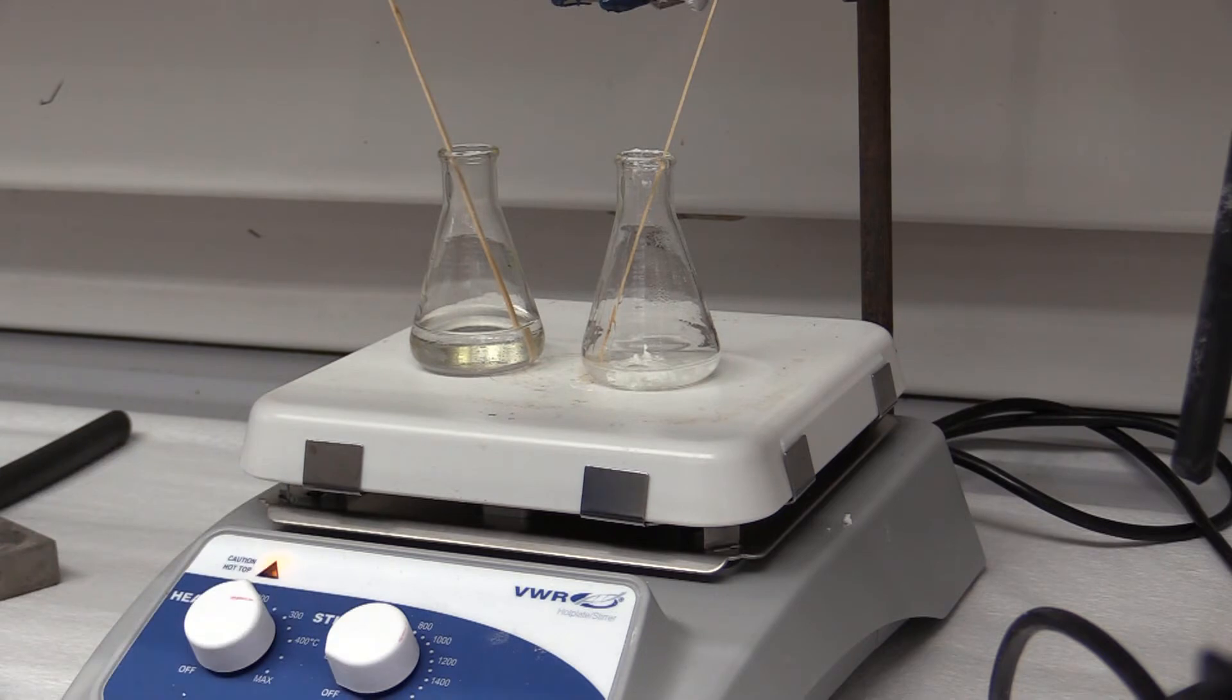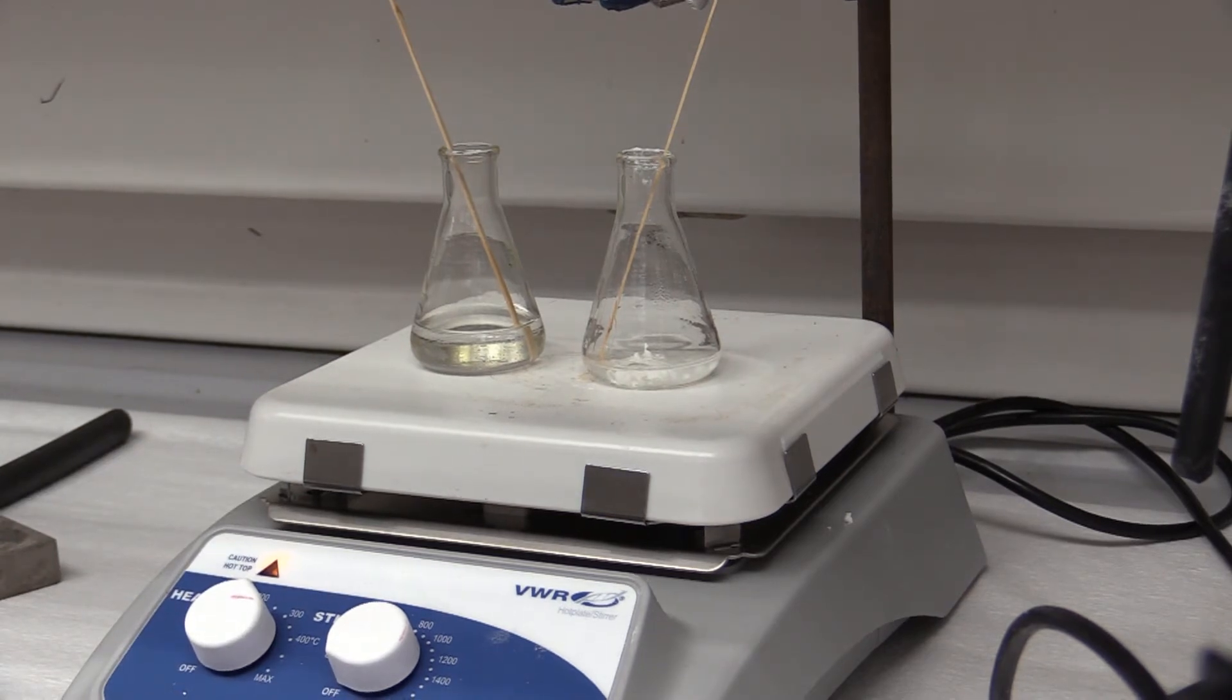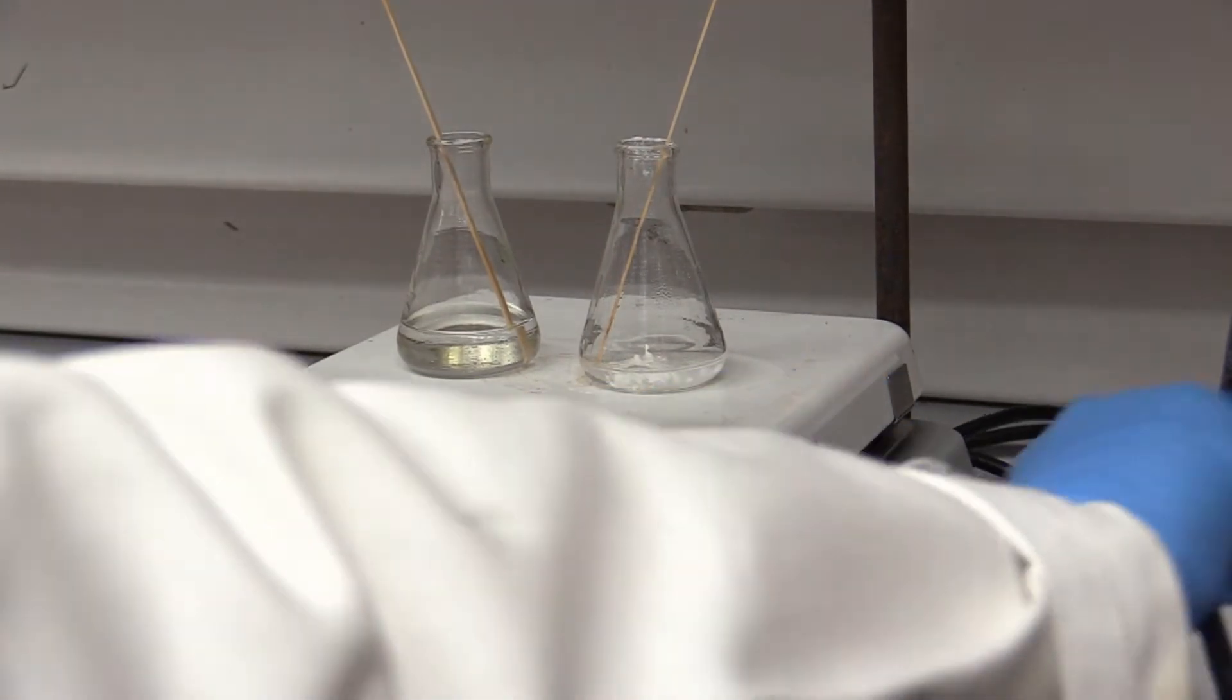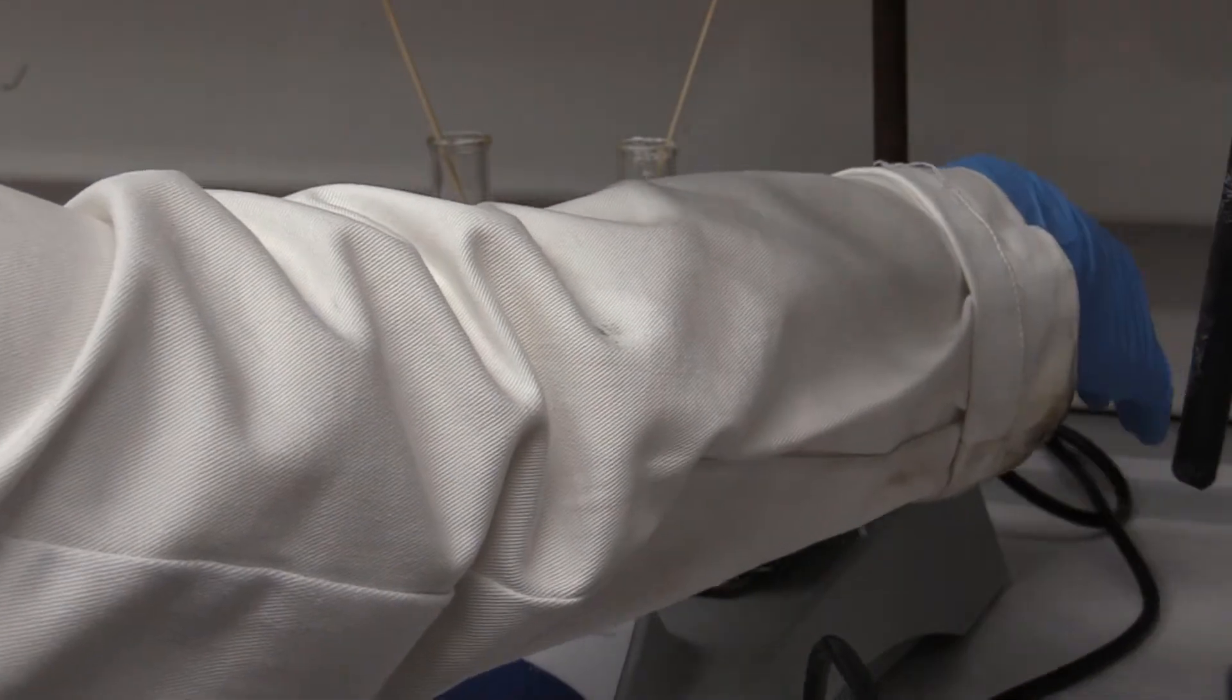Start with the cholesterol and add a little methanol in a flask. Also have a flask with more methanol heating. Heat both mixtures to a low boil. When you turn the heating plate on, make sure the cords are not on the hot plate.